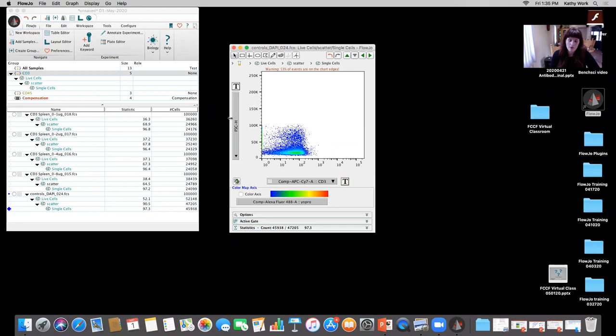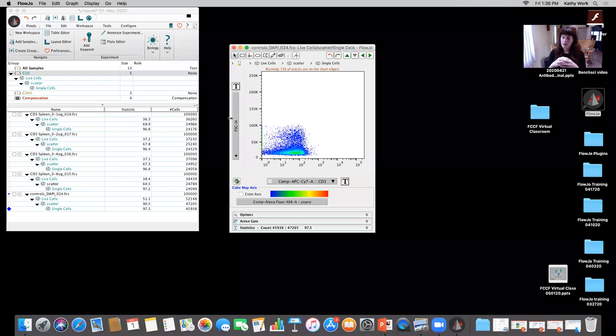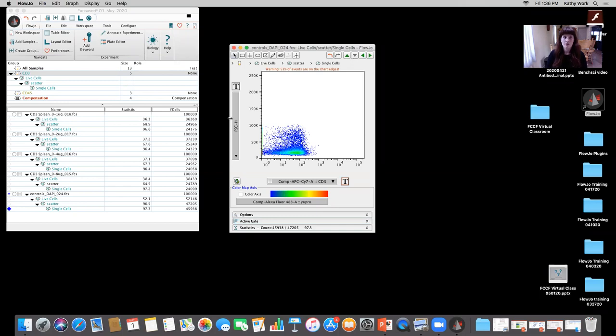Also, when we're talking about antibody titration, we're really trying to identify the point at which your cells of interest, the cells that have the marker that you're looking for, reach that saturation point of the antibody binding to the receptors on or within the cells. And you're looking for the point where the negative cells start shifting up. The data will be a bit skewed if you start including all of the debris in that, because you're not getting a good idea from that perspective of when your negative cells are having all of this excess antibody bound to it through oversaturation and the shift up. So I would always suggest to make sure that you remove your debris before you move forward with analysis.